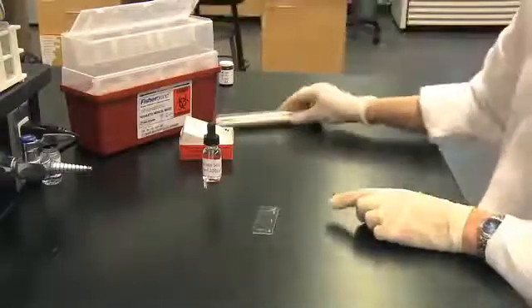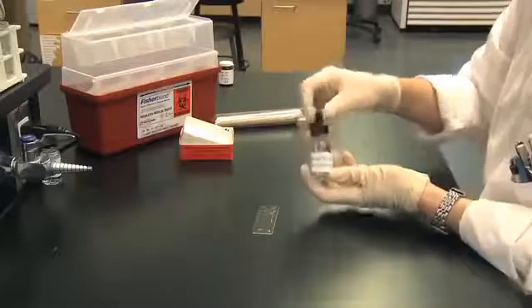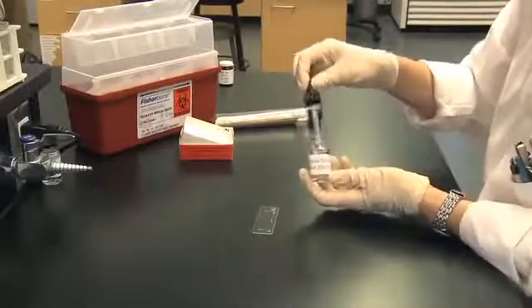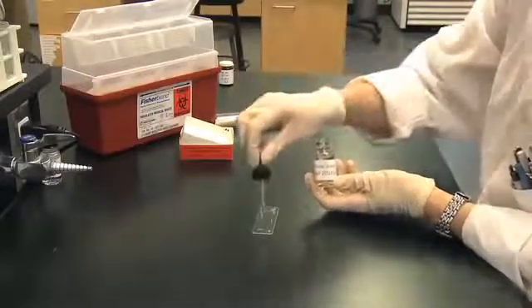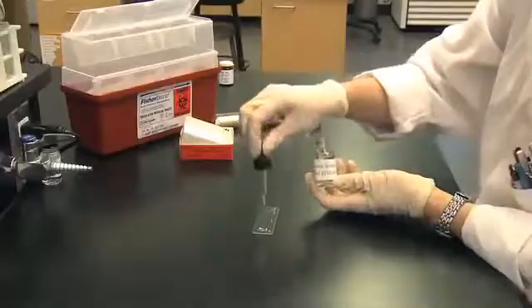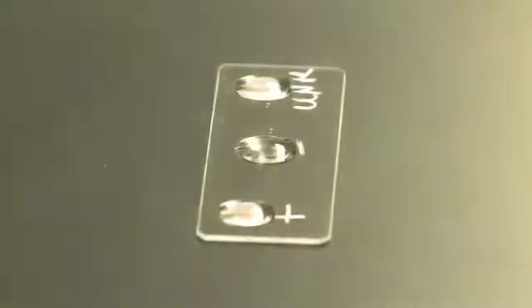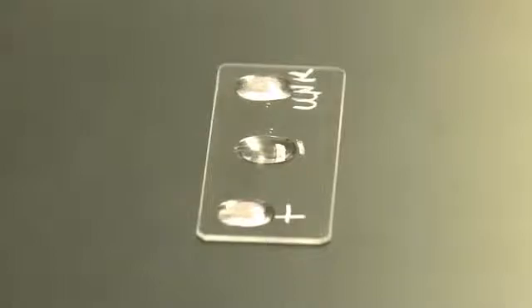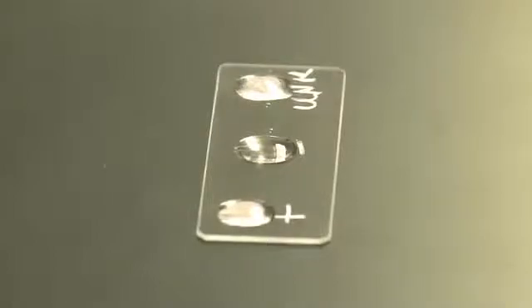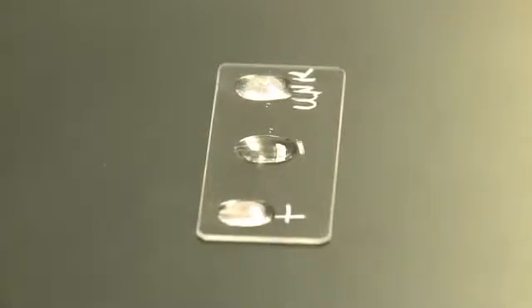Add one drop of catalase reagent, 3% hydrogen peroxide, to each organism on the slide. Observe for bubbles of gas, which should evolve immediately if the test is positive.